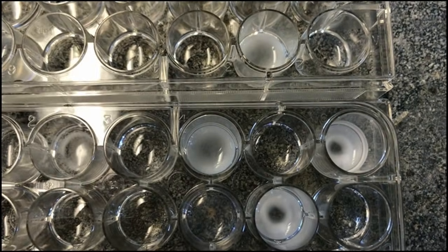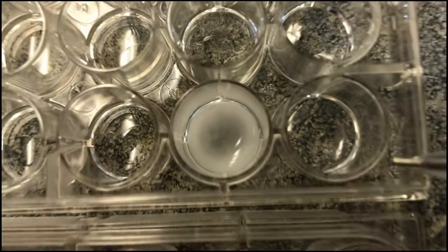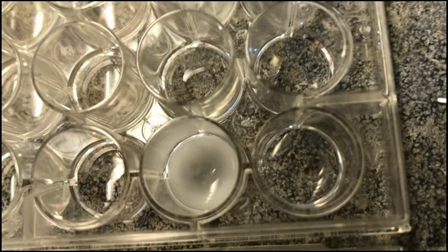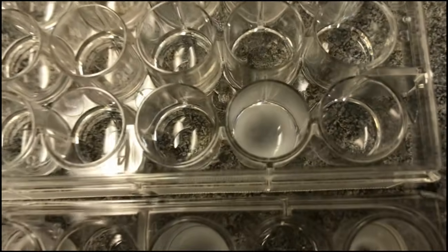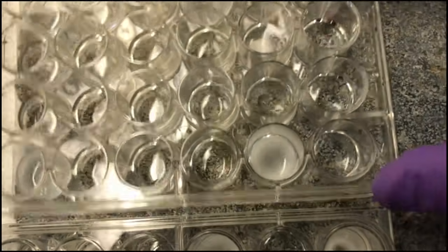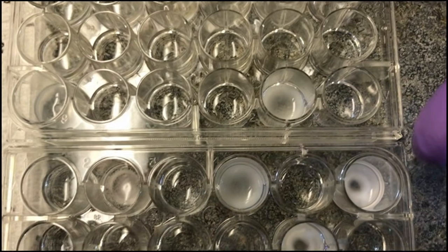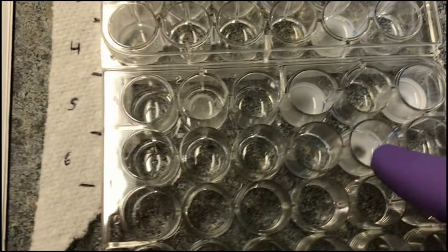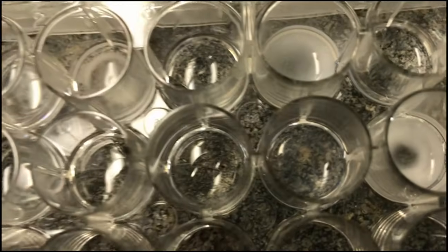What's really hard to see in row 4 is 4 plus 6. There are some grains in there. They're very milky. They're very small. We assure you they're there, though. Right here, yeah, we can see them. If you give it a little shake, maybe they can see it on the video. It's a lot easier to see in person, but we assure you that they're there, and they're also right in this well too. They're just very pale.